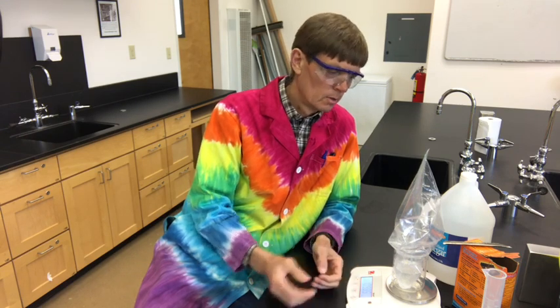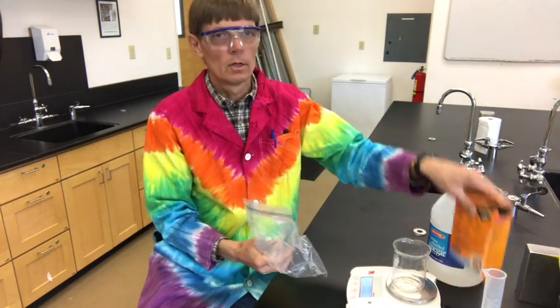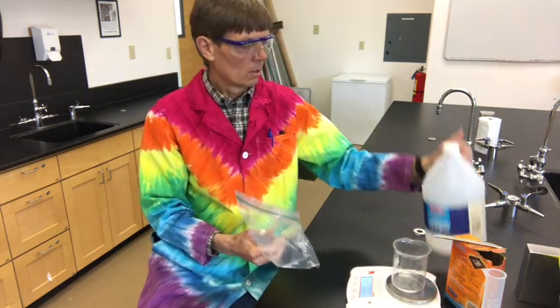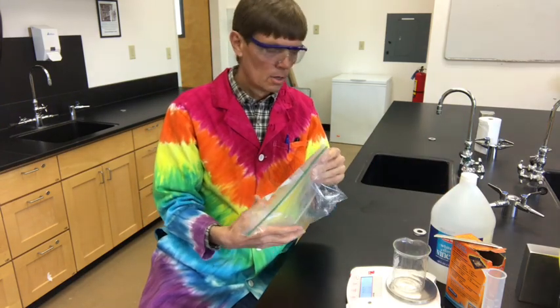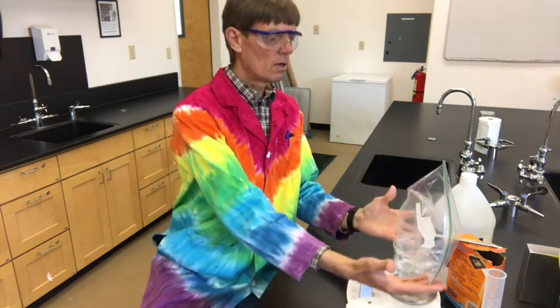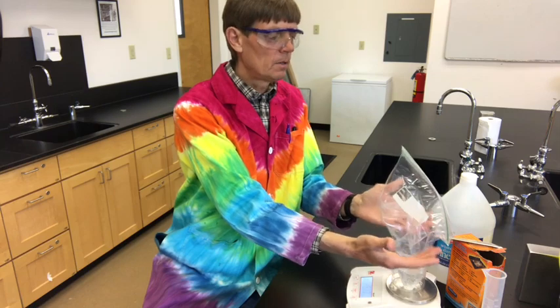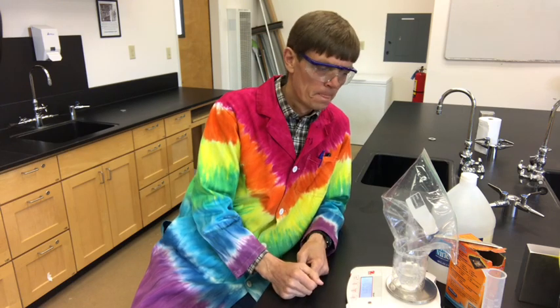But why is it that a helium balloon goes up? It's because it's less dense than the air that surrounds it. When the carbon dioxide went from being part of the baking soda and part of the vinegar to a gas, that made it less dense. And so in fact, the air around here is helping lift up this bag, and it's actually lifting this bag with 2 grams of force up because the carbon dioxide is less dense than it was as a solid.